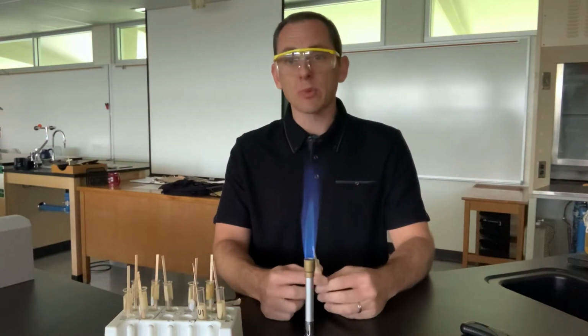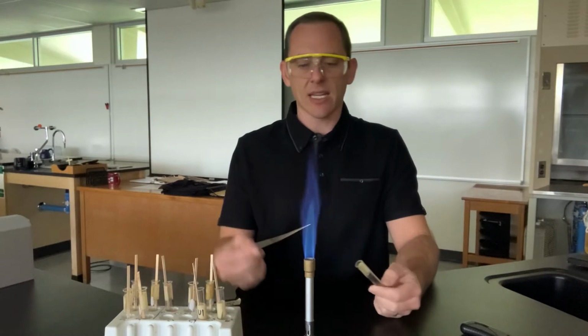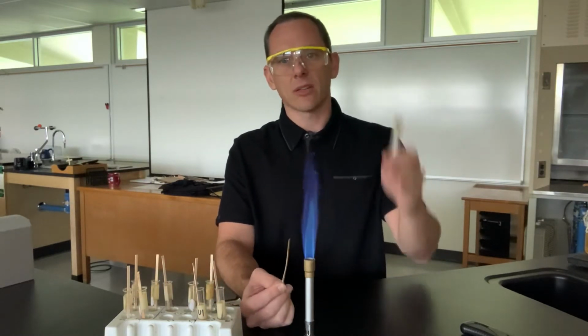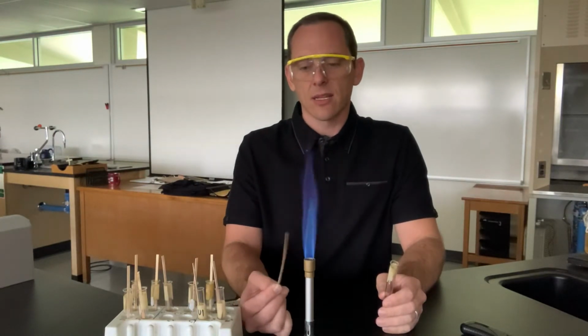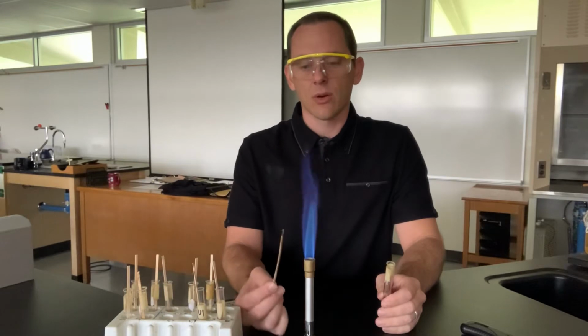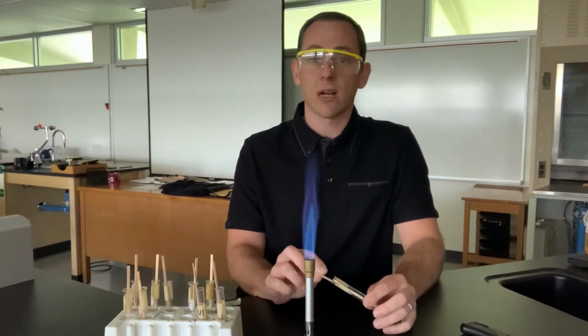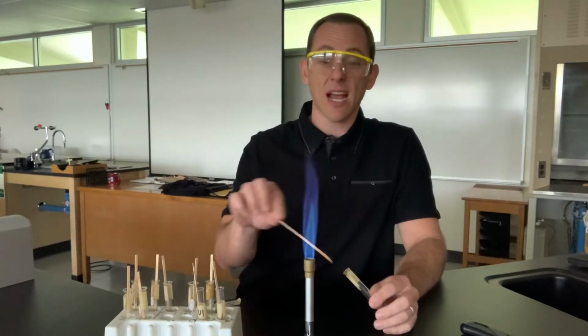So the first one is barium, the symbol is Ba, and so I take the stick and I'm going to put it in the flame down low, and hopefully it'll light and it'll change the color as we go up. As soon as I see the color changing, then that's the characteristic color right there. So what you want to call this is up to you. The name of the color is not important. You being able to identify what element is attached to it is.